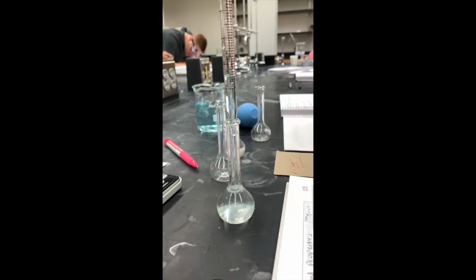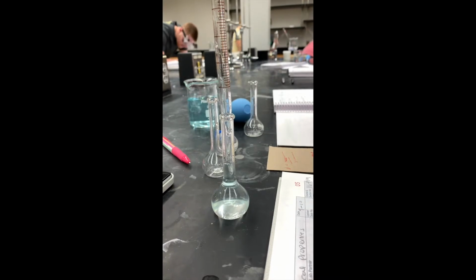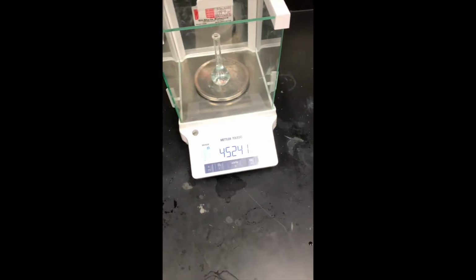Record this data. Before weighing anything on the balance scale, be sure to zero it out first. After weighing items, when writing the calculations, write the number exactly as it appears on the scale. The last number will fluctuate, so be sure to record the number most frequently shown in the last place.